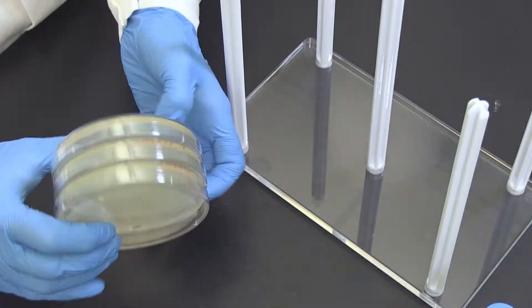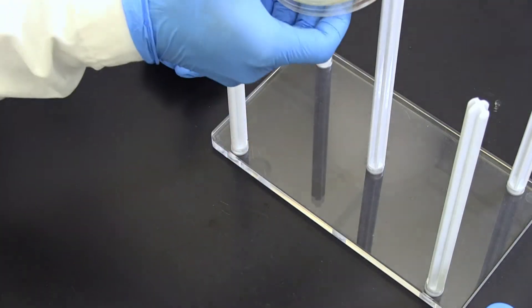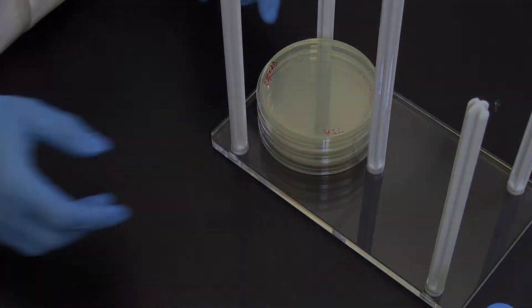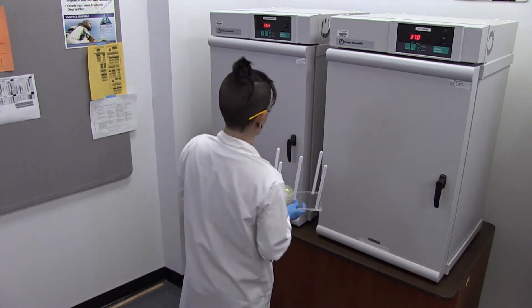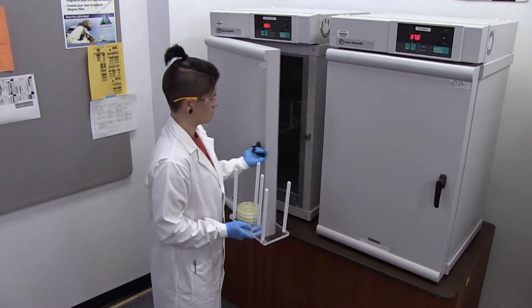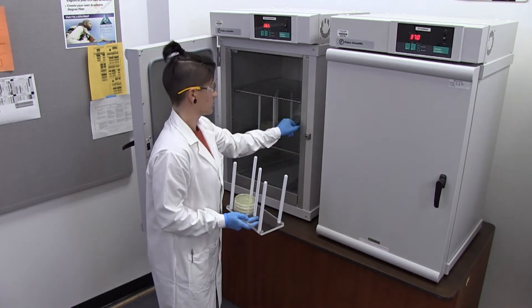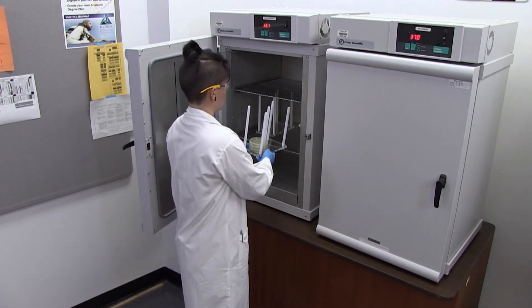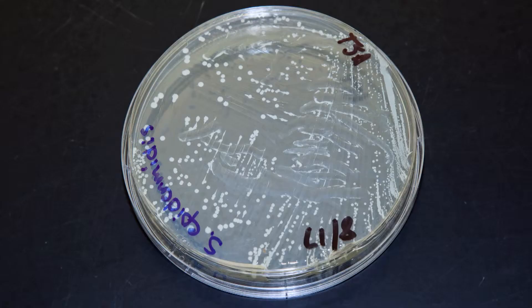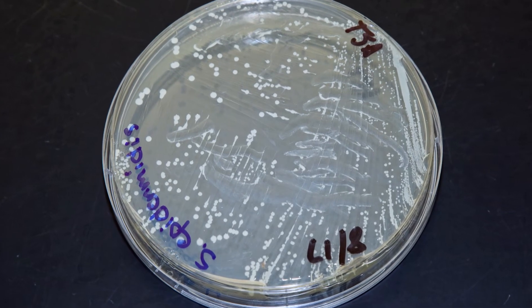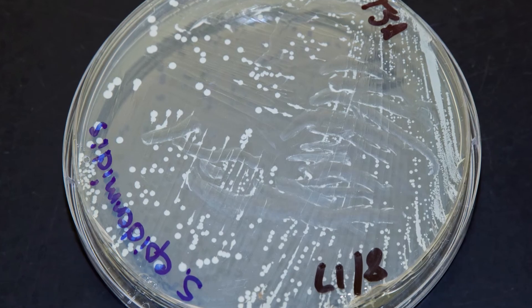Sixth, allow the plate to sit upright for 5 minutes and then incubate it in an inverted position, bottom up at 35 to 37 degrees Celsius for 16 to 24 hours. Results. After incubation, the plates can be observed for isolated colonies.